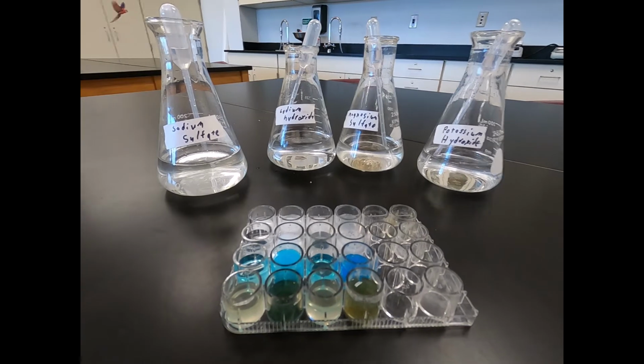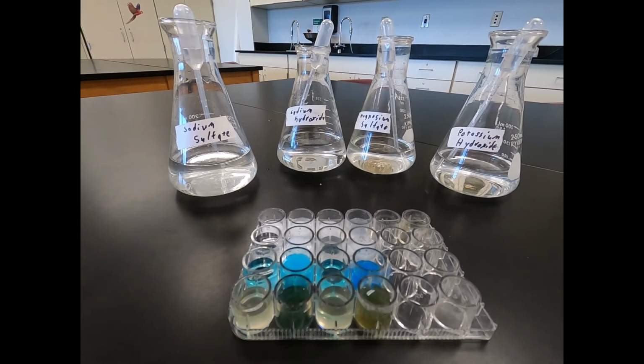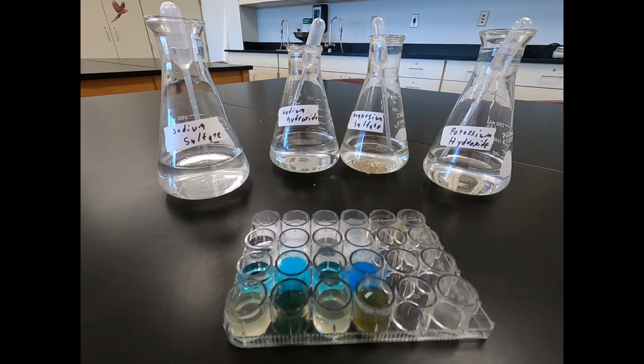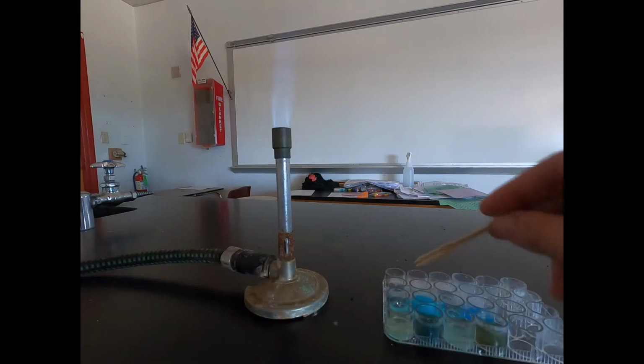Next we're going to take our precipitates we formed, and we're going to do a flame test to help us identify what's left in the solution, and then using that to identify what precipitated out. So for this test, we're going to use solutions we just created, and we're going to put them in a Bunsen burner flame and see what color flames produce from the solution. So we're going to be using the solution, not the precipitate, and figuring out what substance is in that precipitate.